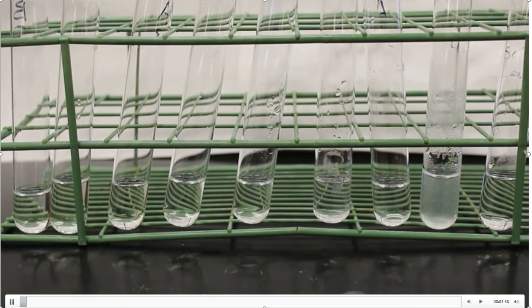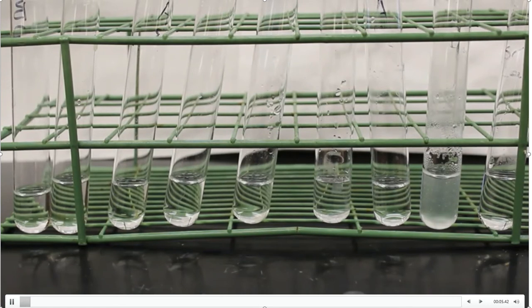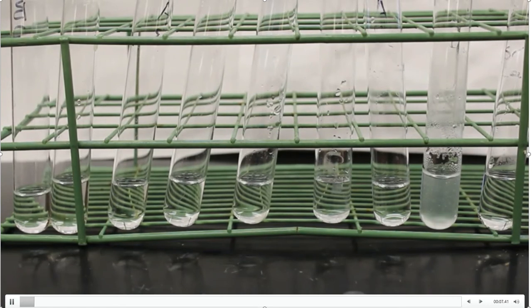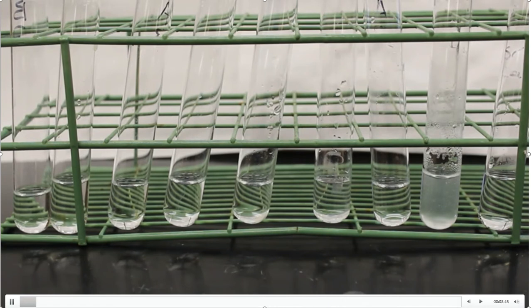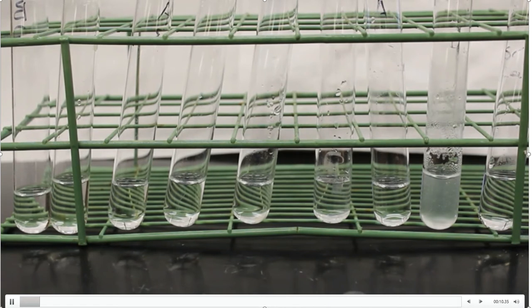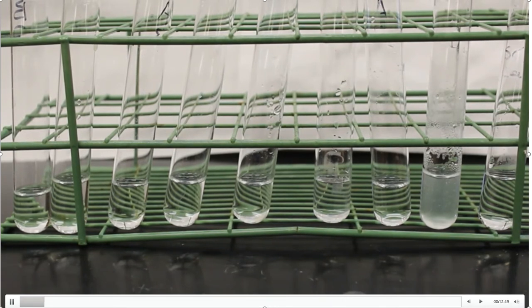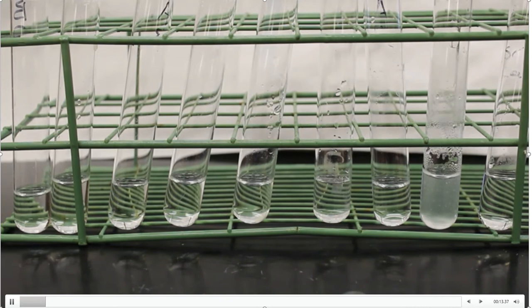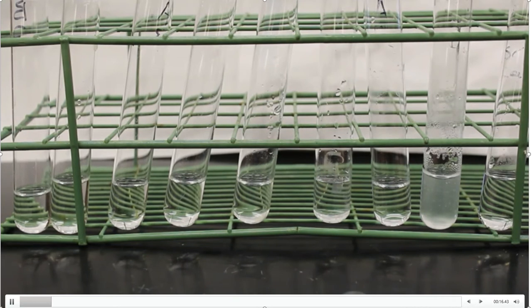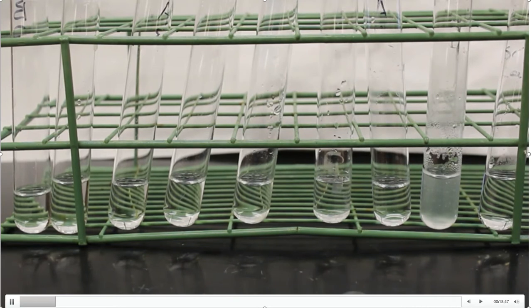All right, folks, so we're getting ready to do our first carbohydrate qualitative test together, and this is the Molisch test. I've got a series of test tubes here. They could be carbohydrates or they might not be carbohydrates — that is for you to decide with the lab procedure.